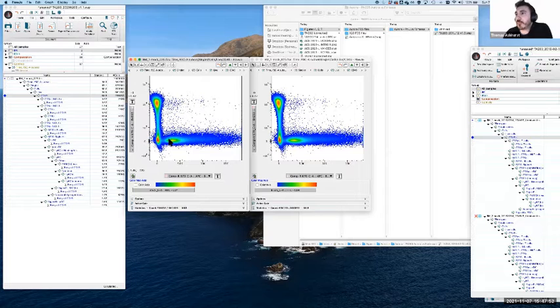I think what this gives us a clue about is that the higher we get, the worse the overcompensation is. If we're looking at this with a linear axis, this high end is all the stuff that previously was right at the top of the plot with a bi-exponential. All of this was previously here, but on a linear plot, it expands it out. And if there are minor differences which are pushing the signal overall under or overcompensating the signal, looking at it in linear can absolutely be a more sensitive way to see those subtle shifts.